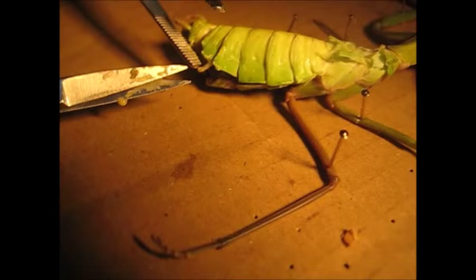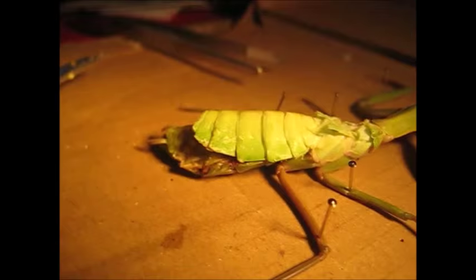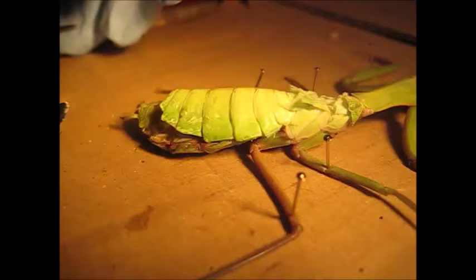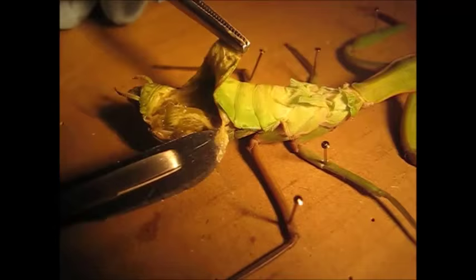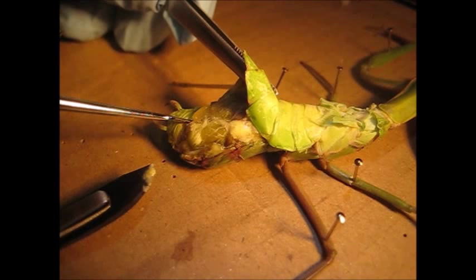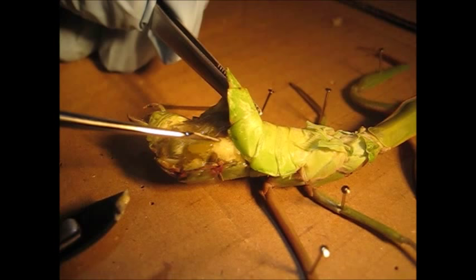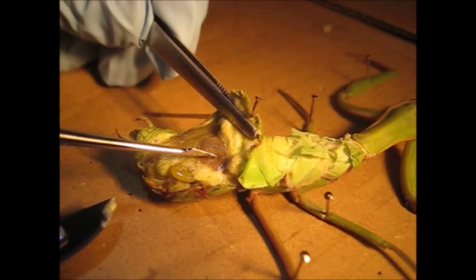This is what I was looking for. You can see just in here these little ropey bits. I'll get the probe and we've got a little prize in here. If we cut some of this away we can see — we'll get the probe out — a little egg! It's a yellow blob there. Those are the eggs; they'll be laid in a styrofoam-like pouch. They come as an ootheca, which means egg membrane. I think that may be the intestines in there, so we might find some chewed-up locust. I've only done one dissection like this before, on Schistocerca gregaria, a plague locust, which has kind of similar structures. All this ropey stuff here is where the eggs come from.